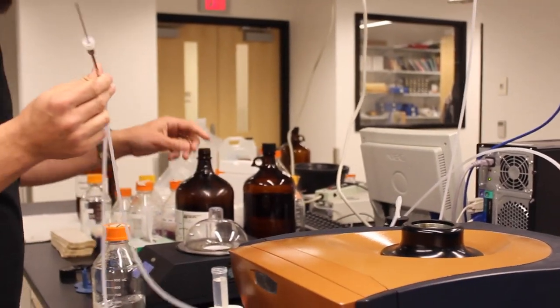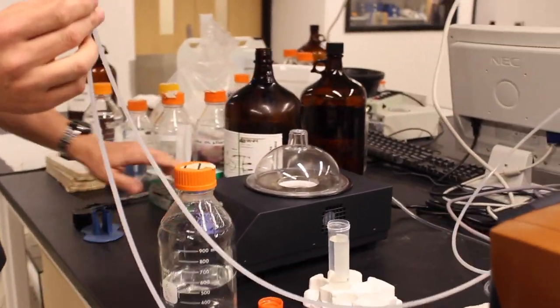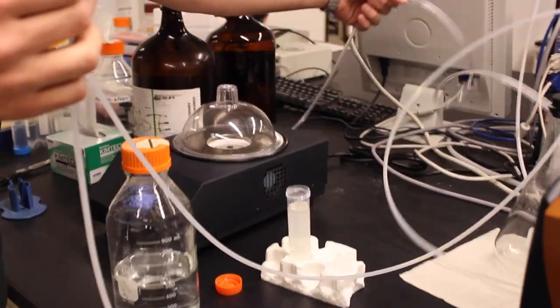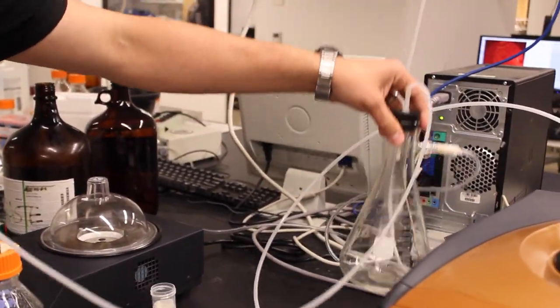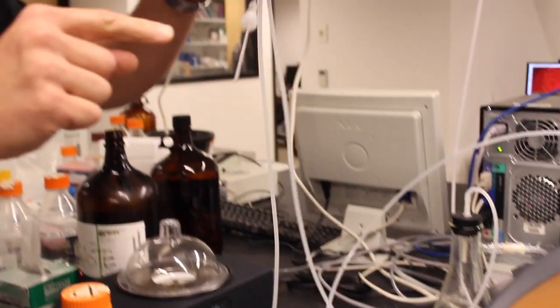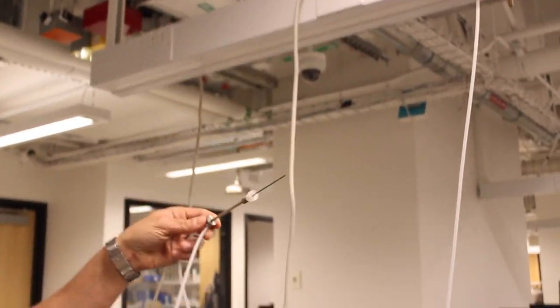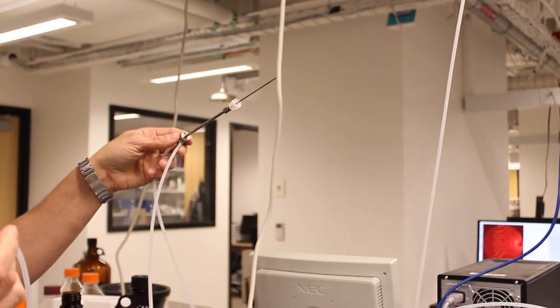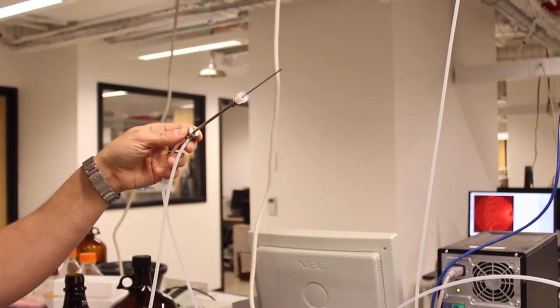This attaches to the degassing station and pulls a vacuum through this bottle that will collect any waste liquid through this device which goes down into the syringe and then it will suck up any solution from this tube here.